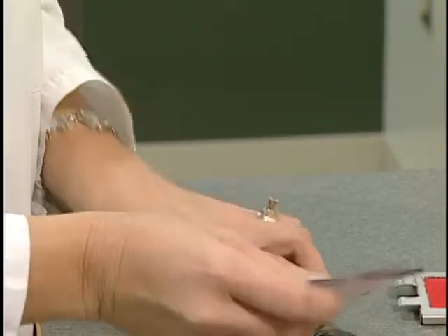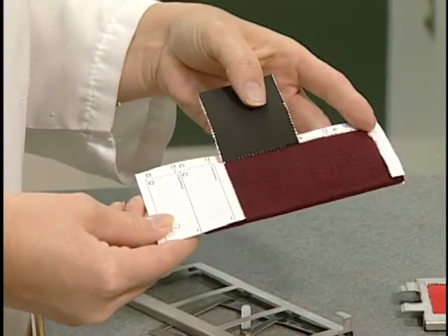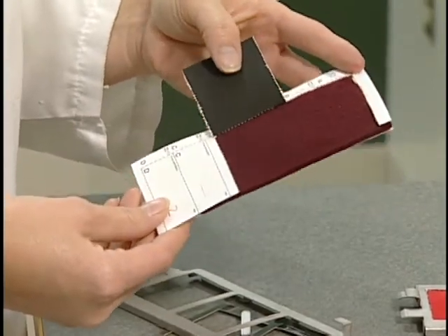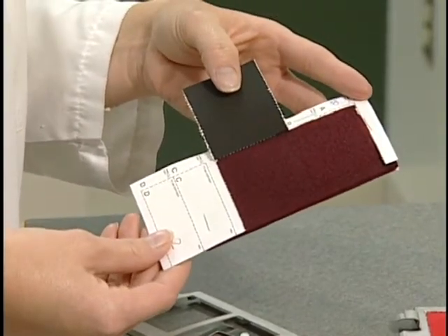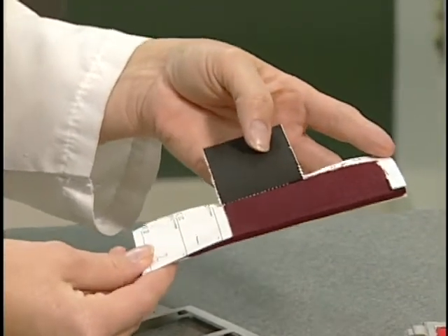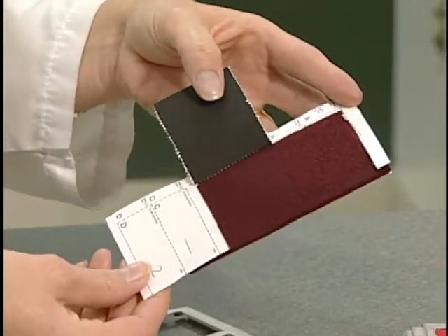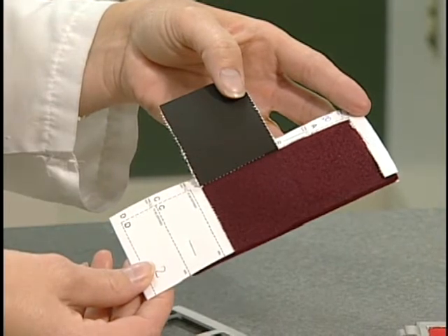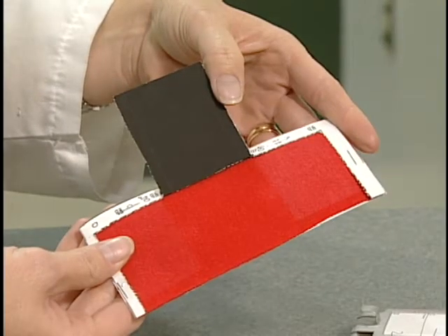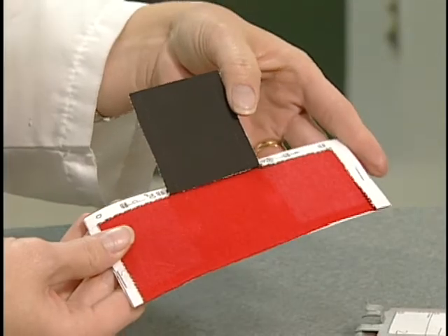The colorfastness to light of the specimen is evaluated by comparison of the color change of an exposed panel to the masked control portion of the test specimen. This burgundy sample was exposed on only one panel for a total of 20 hours. This red specimen was exposed for 20 and for 40 hours.